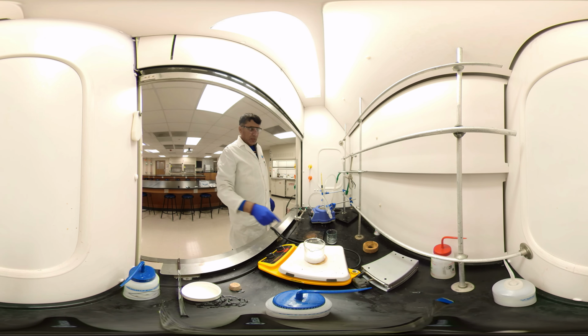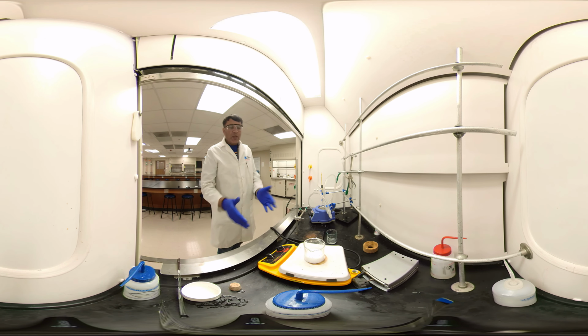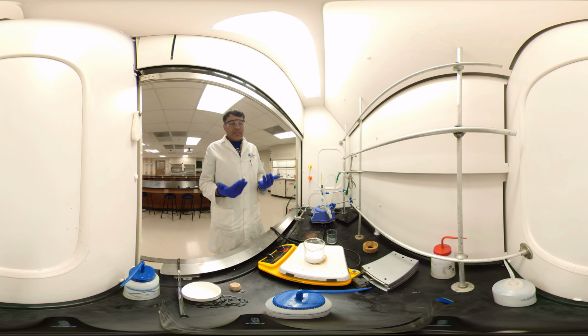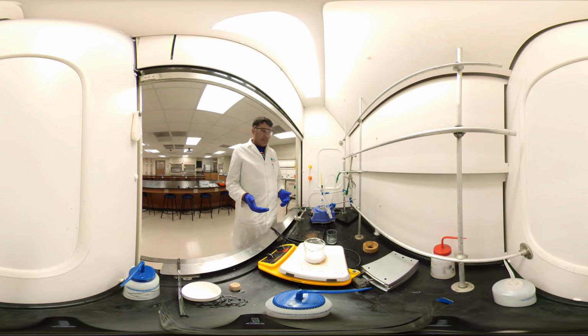See, the dichloromethane is coming. It's working on the side, and here we stir it slowly. We'll keep heating until we dissolve everything, the benzoic acid, because it is soluble in hot water. And when you cool down, we get nice crystals. That's the step of purification. We call it recrystallization. Okay? So the compound dissolves in hot solvent and reappears in cold solvent.